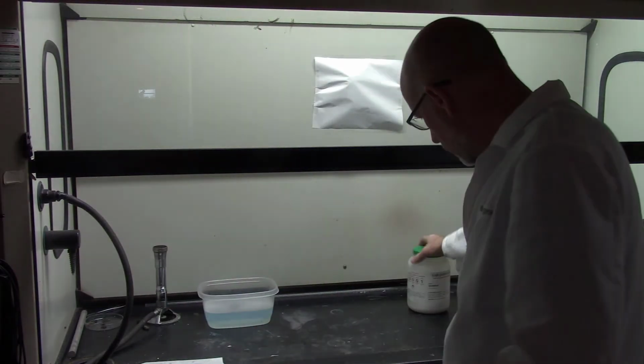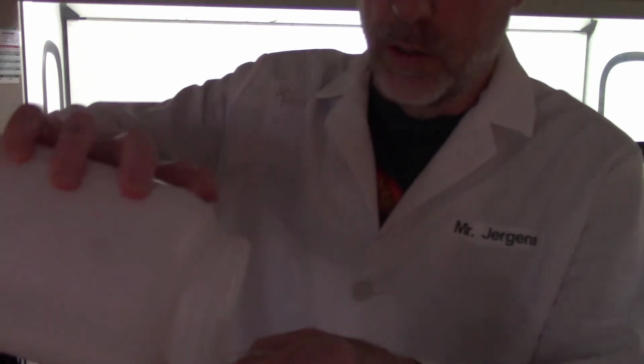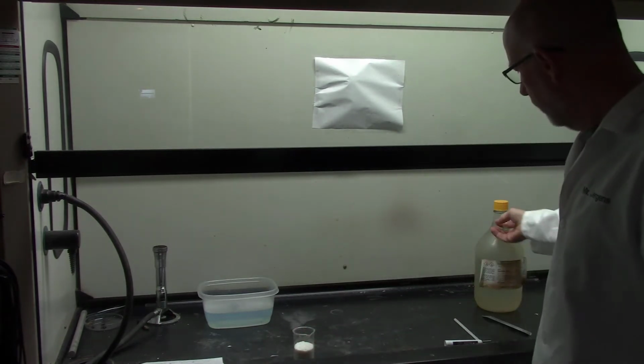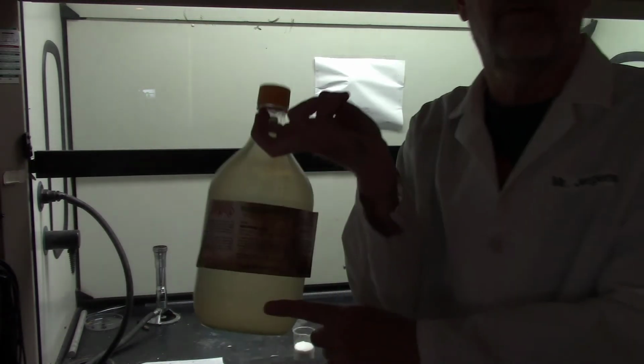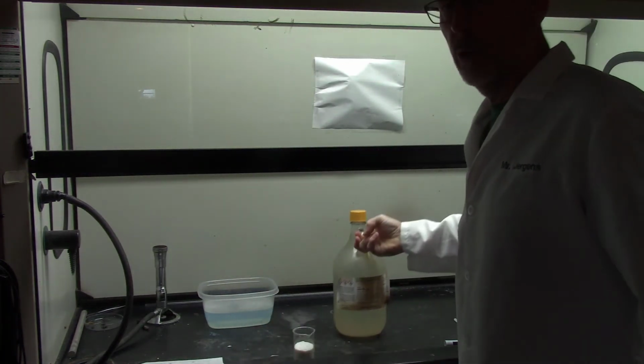Let me show you what sucrose looks like. It looks like sugar. There, we'll just put quite a lot in here. How's that? About like that much? And the next thing I'm going to take is some stuff called sulfuric acid. Now you know sulfuric acid from your flashcards. Look at that nasty old bottle. Sulfuric acid. How do you remember the formula?